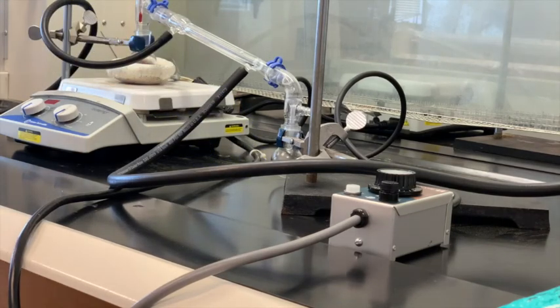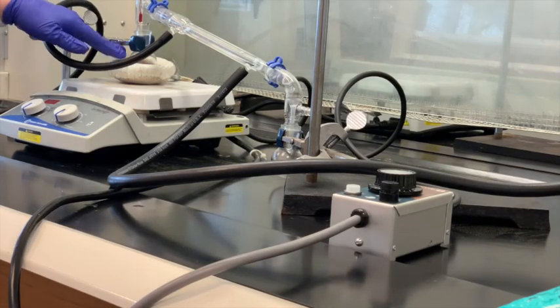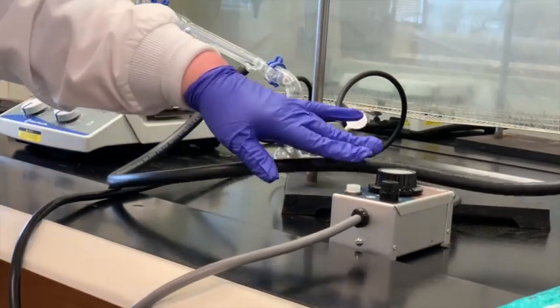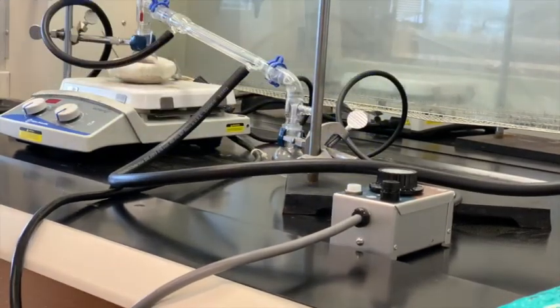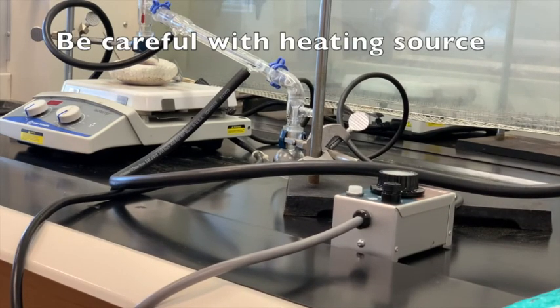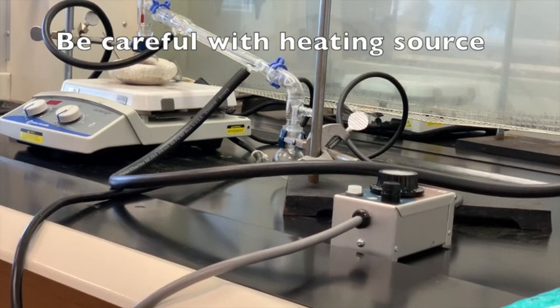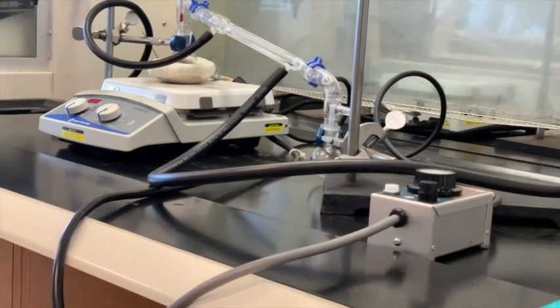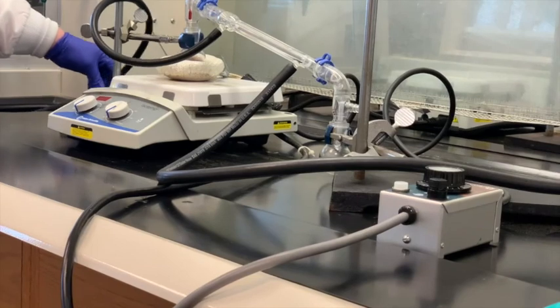We need some type of heat source. I'm using a heating mantle that's connected to a variac, and this variac, I can control what the temperature is. We typically don't want to heat anything extremely high, but we need enough heat in order for the distillation to occur.